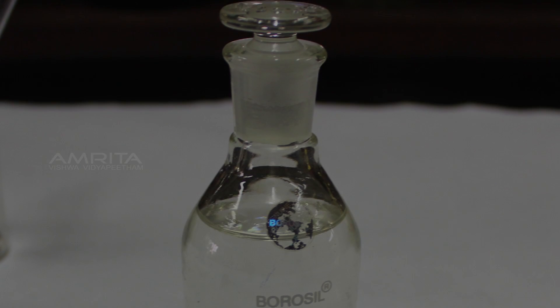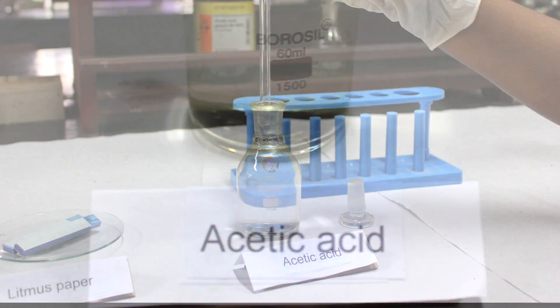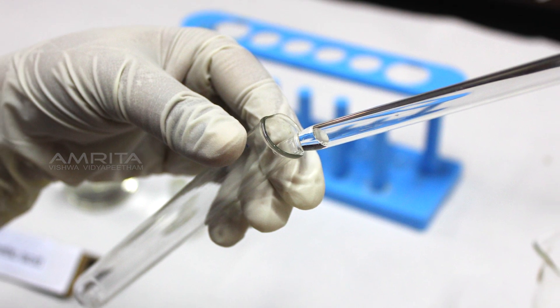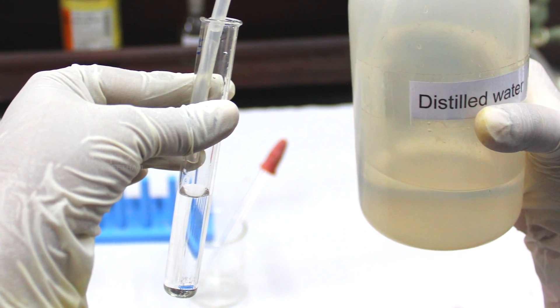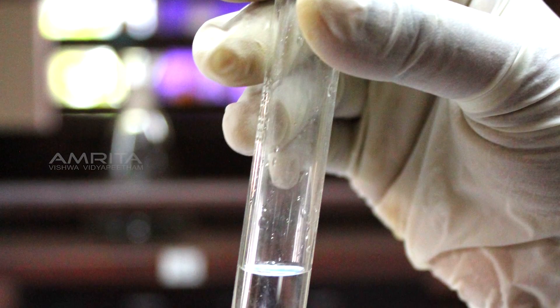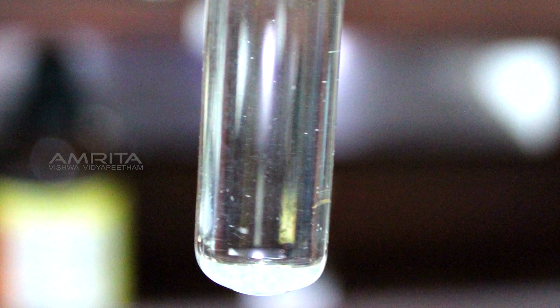Procedure. To find the solubility of acetic acid in water, pour a few drops of acetic acid into a test tube using a dropper. Add a small quantity of distilled water into this test tube containing acetic acid and shake it well. Observe that a homogeneous solution is formed, which indicates that acetic acid is soluble in water.